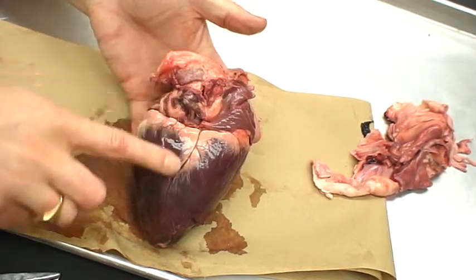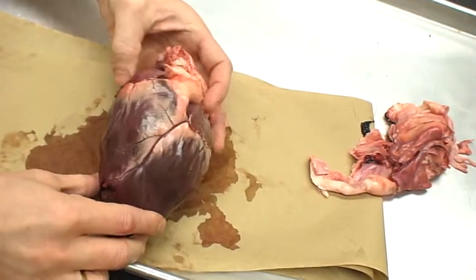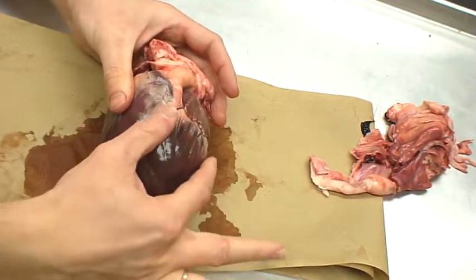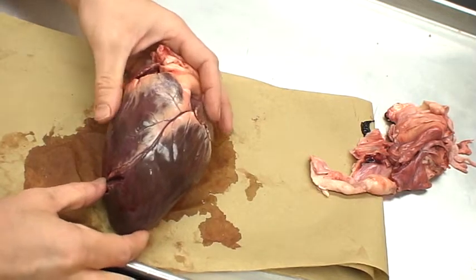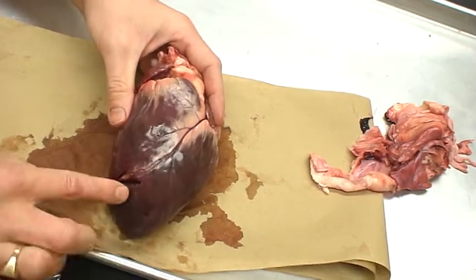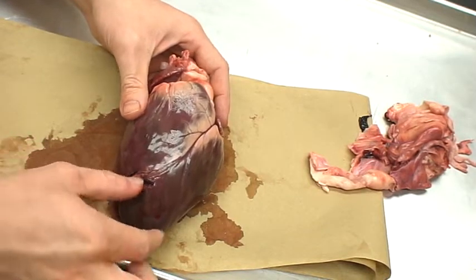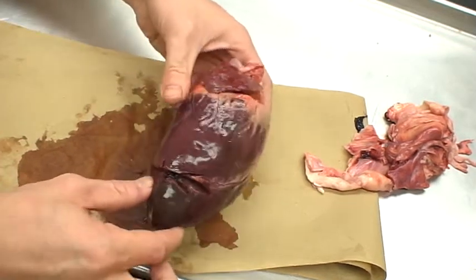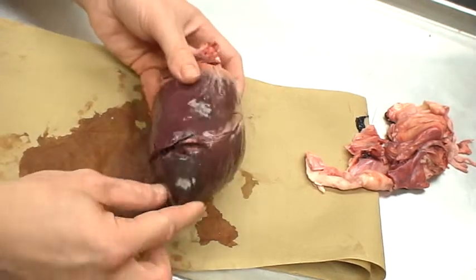Okay, this is the back of the heart, the dorsal part of the heart. This is the ventral part. Now you'll notice that we have one big chamber that runs here and around the apex. This is the left ventricle region. In fact, the heart was damaged at this point, right at that separation point between right and left ventricle. Now, we'll see that it wraps around to this point.